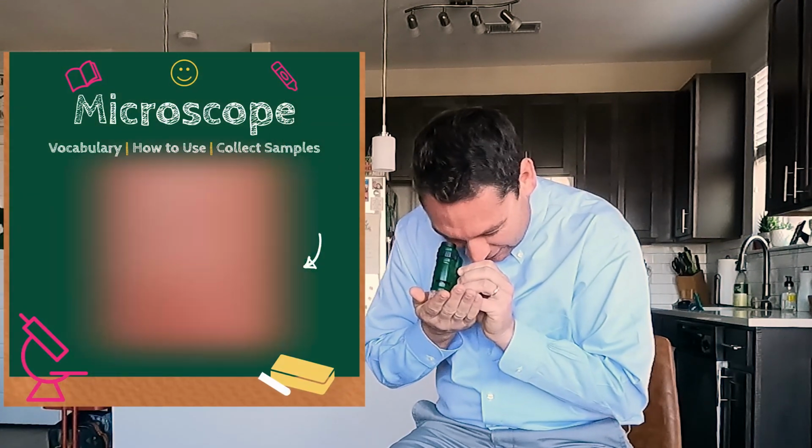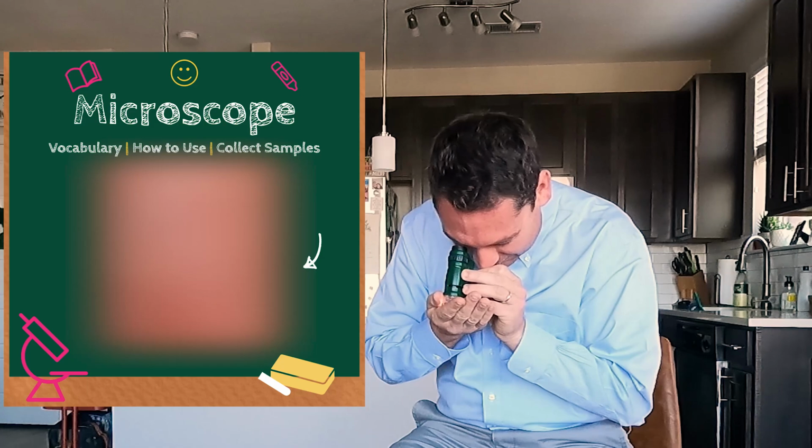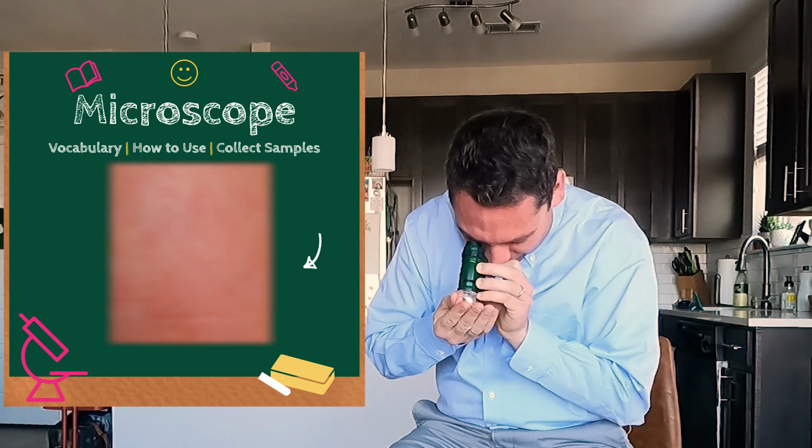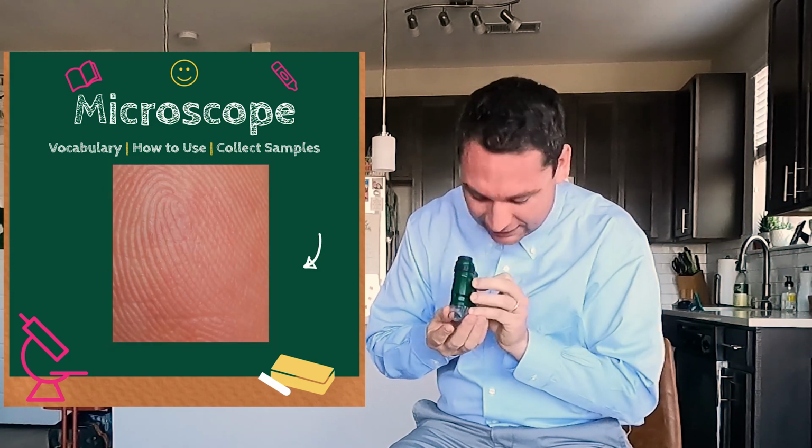One thing that I like to do, just to get used to it, I like to turn my magnification all the way to the right, so that it says 20 times. And then I just hold the microscope up to my hand and I'm looking for the little lines that are on my hand. So I turn my light on, I look through the eyepiece, and then I adjust the focus just a little bit until I can see all the ridges on my finger. That's perfect. This little microscope right here magnifies just as much, if not more, than the microscopes that you probably have at school. And this one you can take anywhere and explore anything.